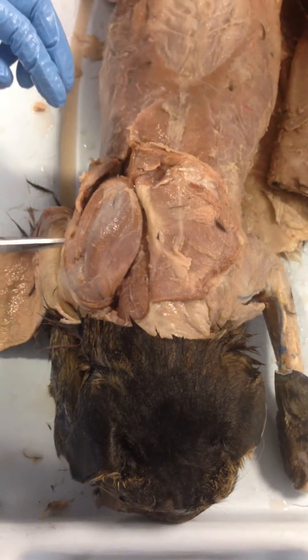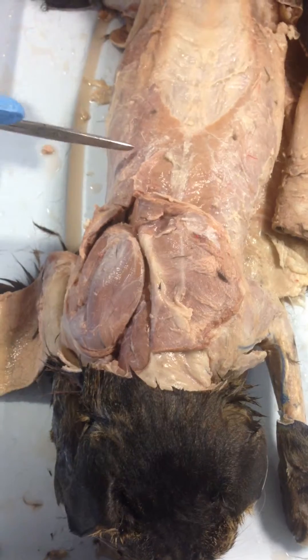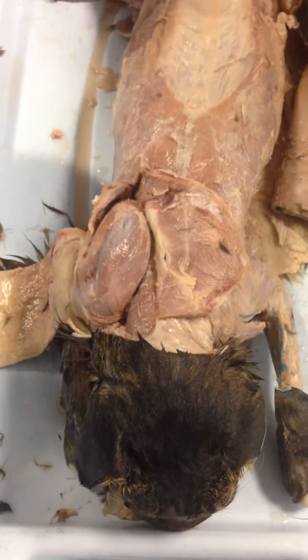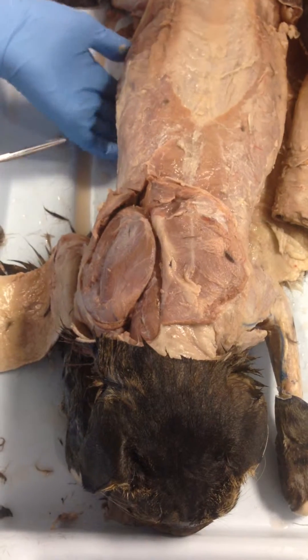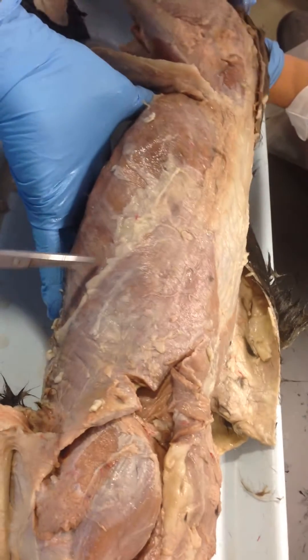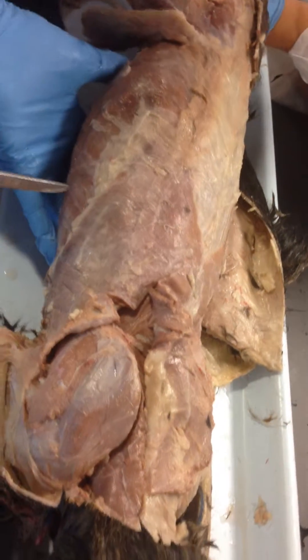And then we've got the latissimus dorsi — that's this over here on the side. Can you show the line between the latissimus dorsi and the external oblique? Right here on the edge, you see it's a little bit fatty lines. That separates them.